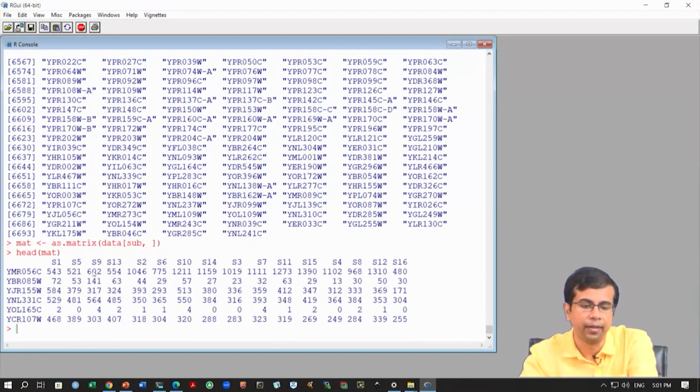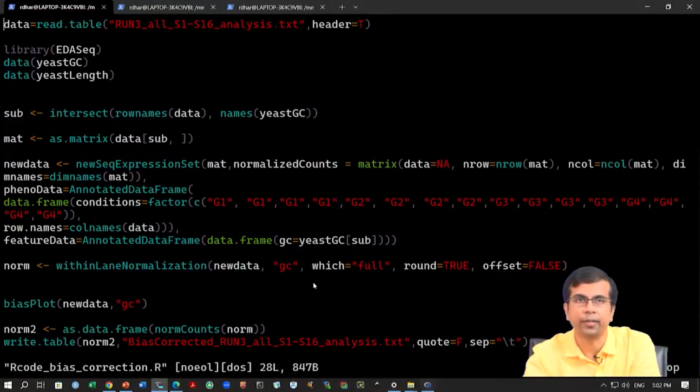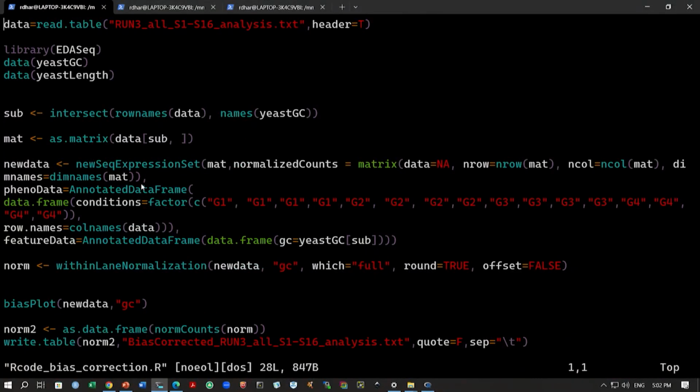As you can see, again we have the samples and the genes. The only difference is that now we are working with only a subset, which are common across these two data sets. Because we cannot do GC content correction if we do not have the GC content data for a gene, we need to work with only the intersection between these two data sets.